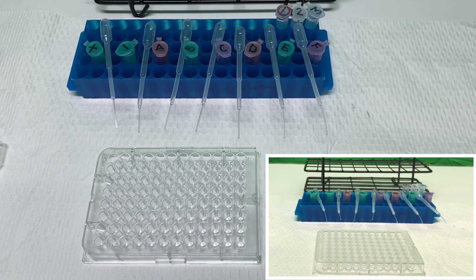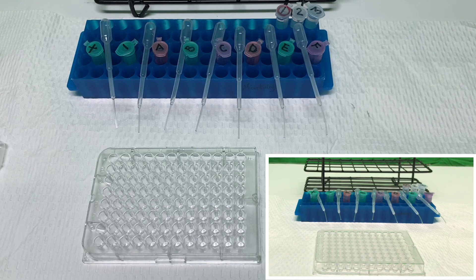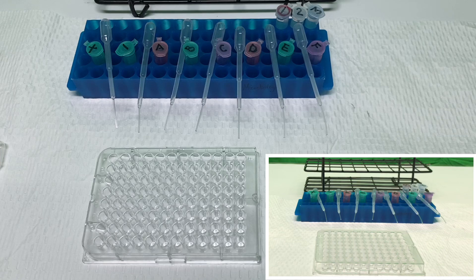Once they are added in triplicate to the actual plate, we will then proceed to add the first, second, and third set of substances, which are the primary, secondary antibodies, and the third, in this case being the chromophore and chromogen substance. So let's set this up.